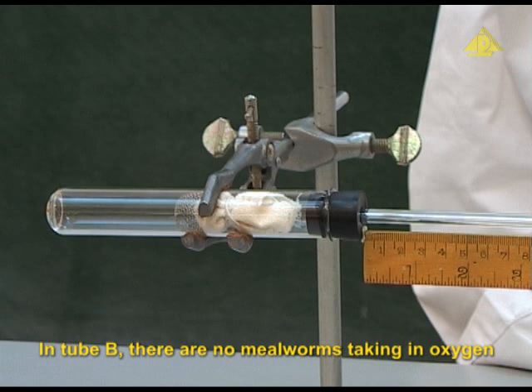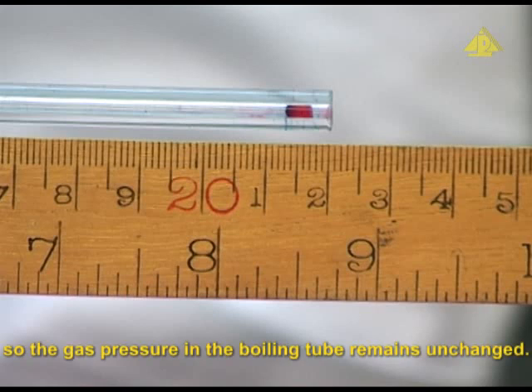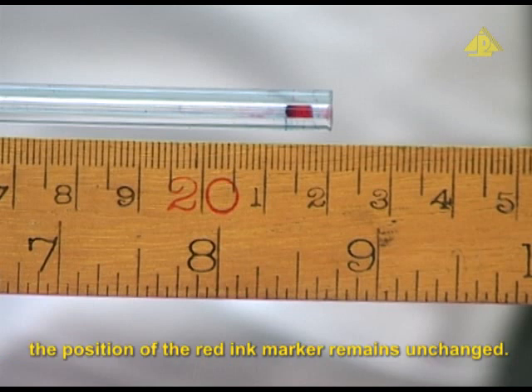In tube B, there are no mealworms taking in oxygen and giving out carbon dioxide, so the gas pressure in the boiling tube remains unchanged. As a result, the position of the red ink marker remains unchanged.